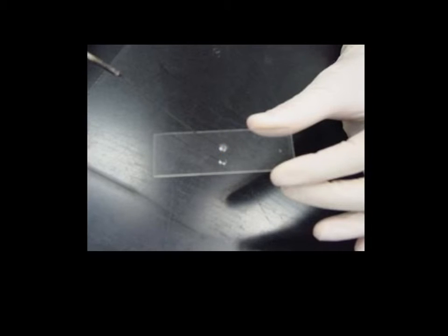Now after we have done this, again it is very important that we allow our bacteria smear to air dry. We cannot simply heat the sample up or blow on it.